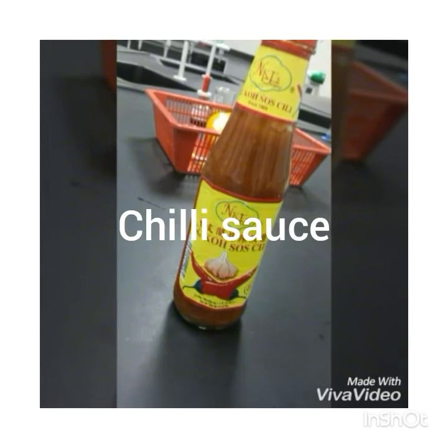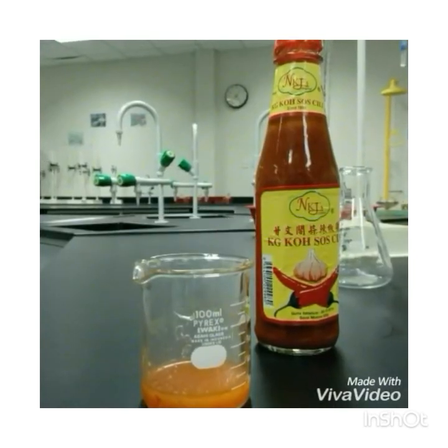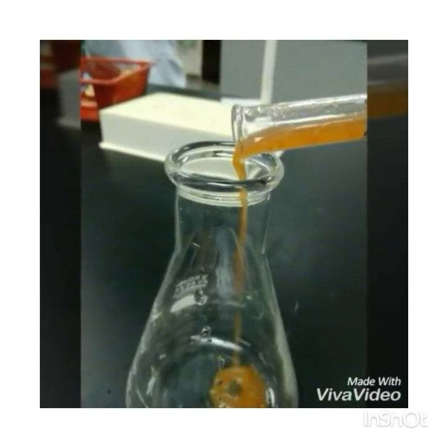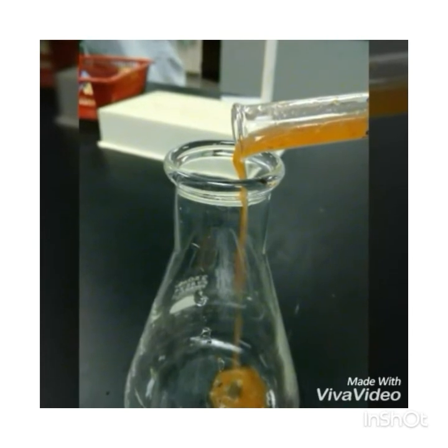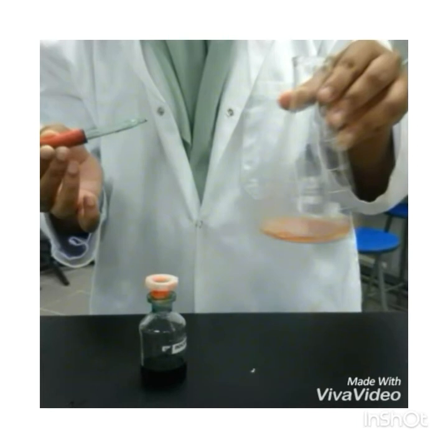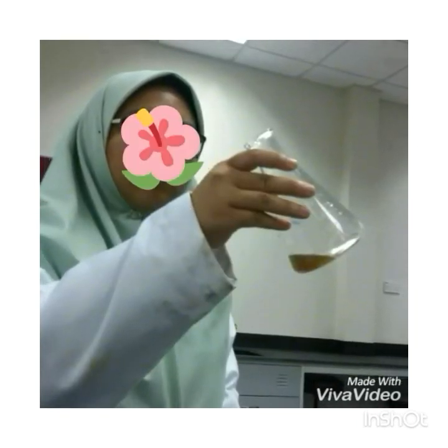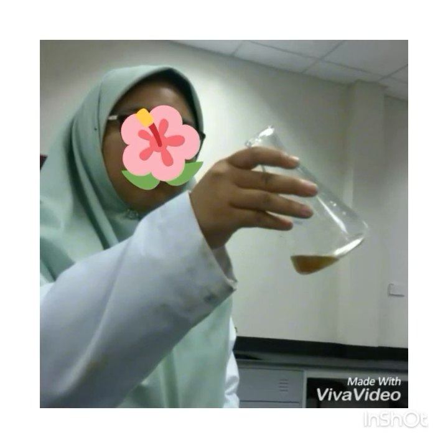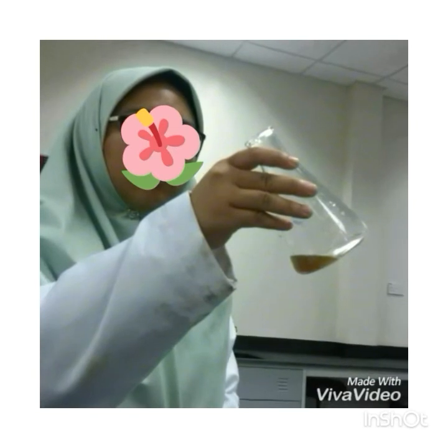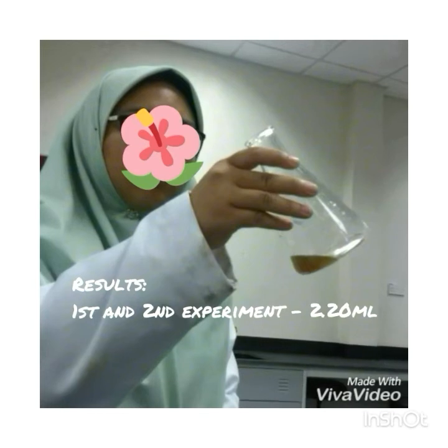Next, we tested chili sauce, which we test by making a mixture of chili sauce and water as if it was paste. We used 5 cm cube for the mixture. Then added another 4 drops of indicator into the mixture. We followed the same process for the other 3 samples. Added sodium hydroxide until the chili sauce mixture turned into a yellowish brown color. The reading for the first and the second time is 2.20 milliliters.